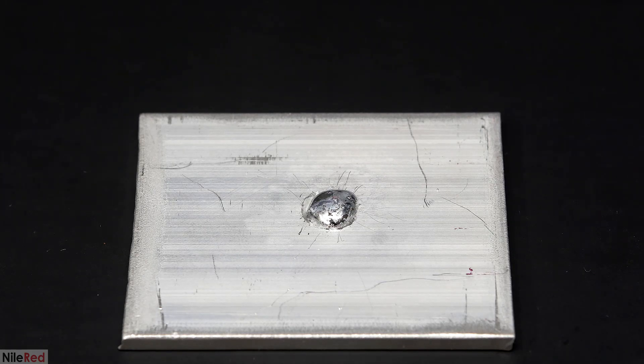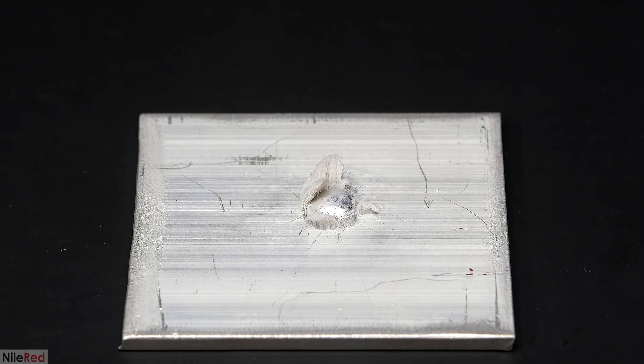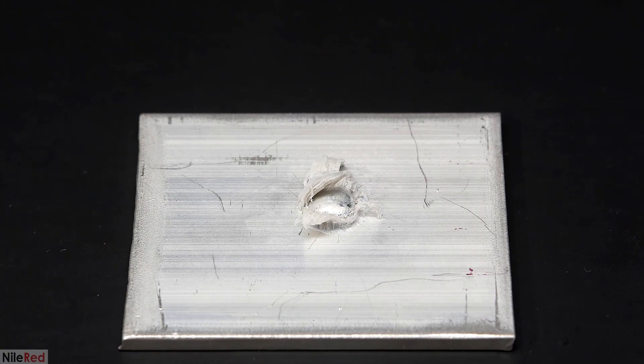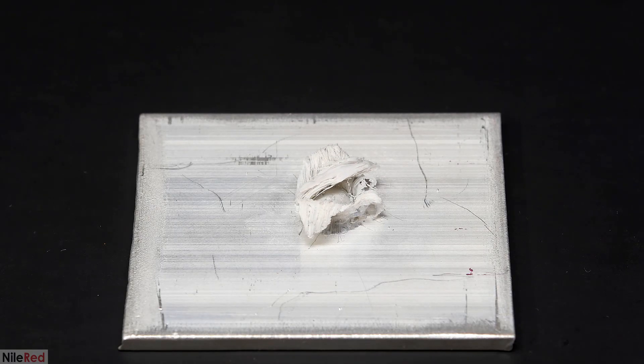This is a follow-up to the aluminum and mercury video that I did about a month ago. If you haven't seen that one yet, I highly suggest you watch it before this one, otherwise it might not make sense.